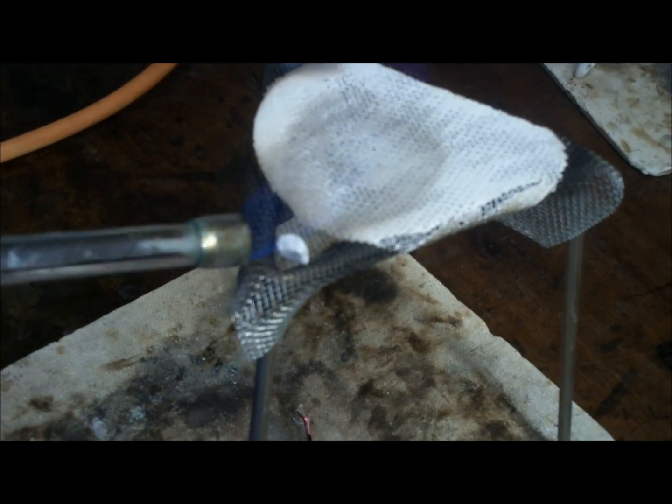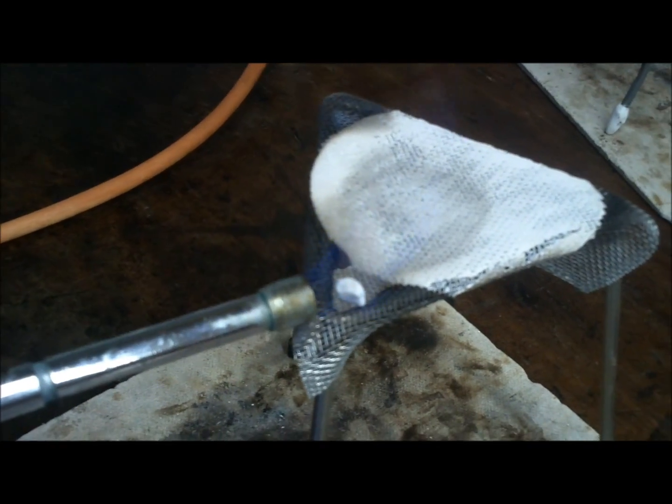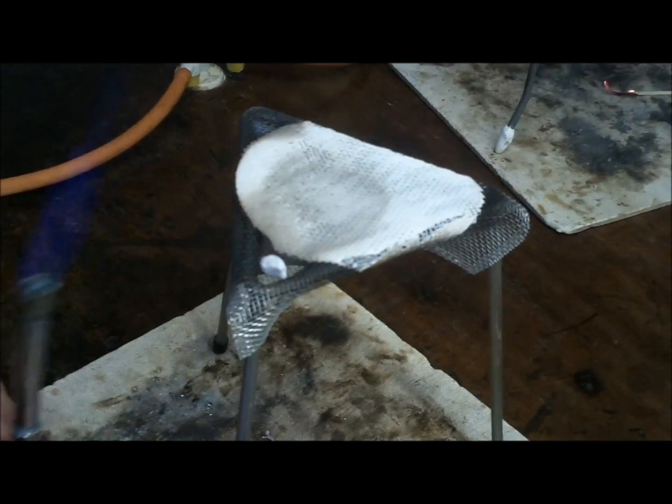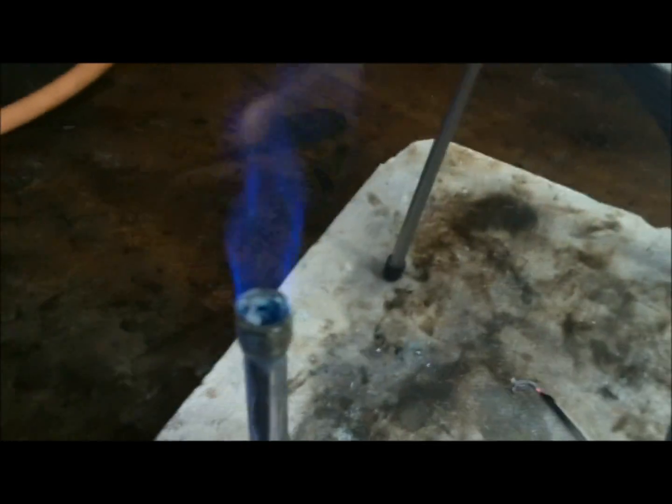Use the roaring hottest part of the flame — use the blue pyramidal peak. It's not a very hot one, anyway. Have you got another burner? It's not a brilliant burner. You go and get another burner. Might be the best we can get, Bunsen-wise.